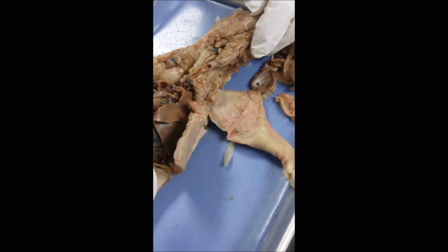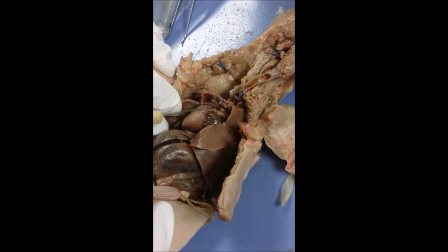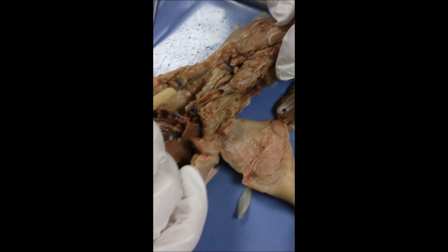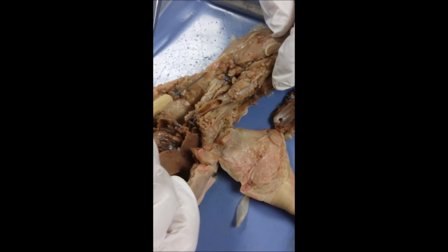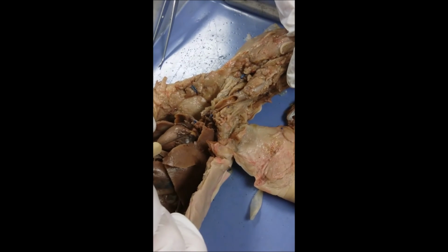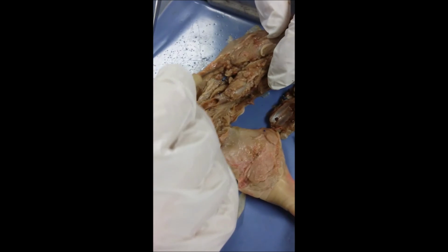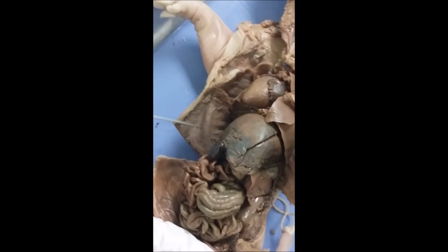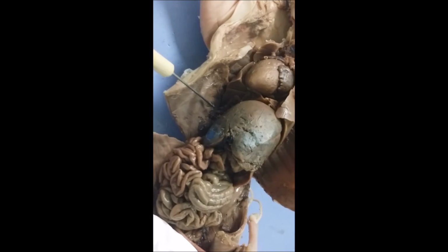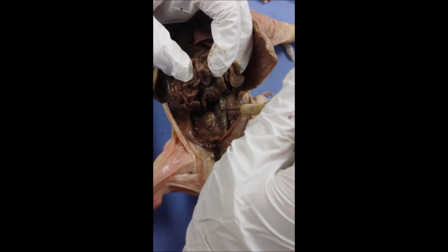Okay, so we have the aortic arch, which is this part right here, and it comes out of the heart and wraps around down. And then up here are the common carotid arteries. The blood gets pumped from the aorta through those up to the brain. So the aorta is down here, and then the pancreas is right here next to the stomach.